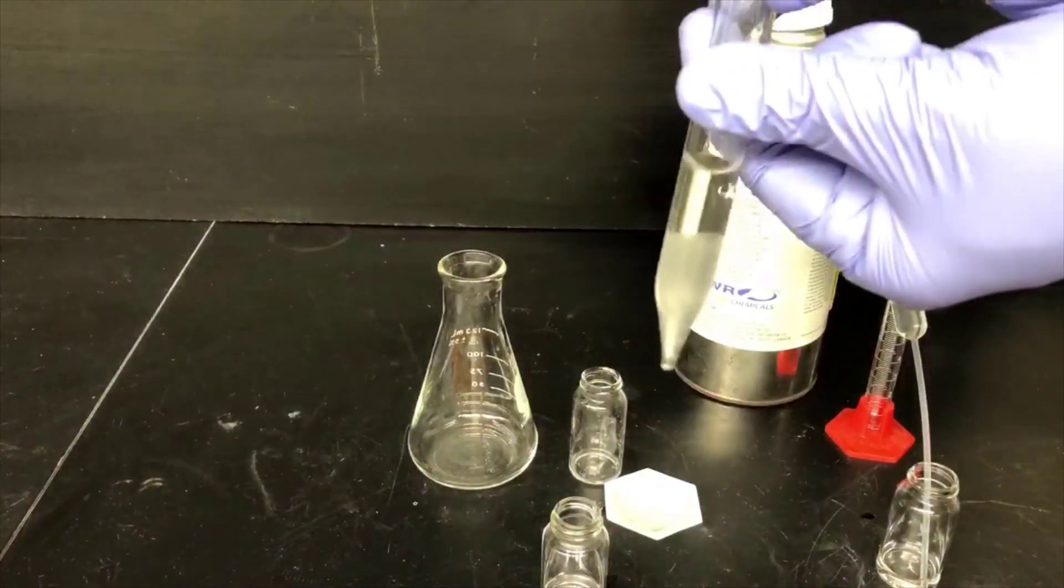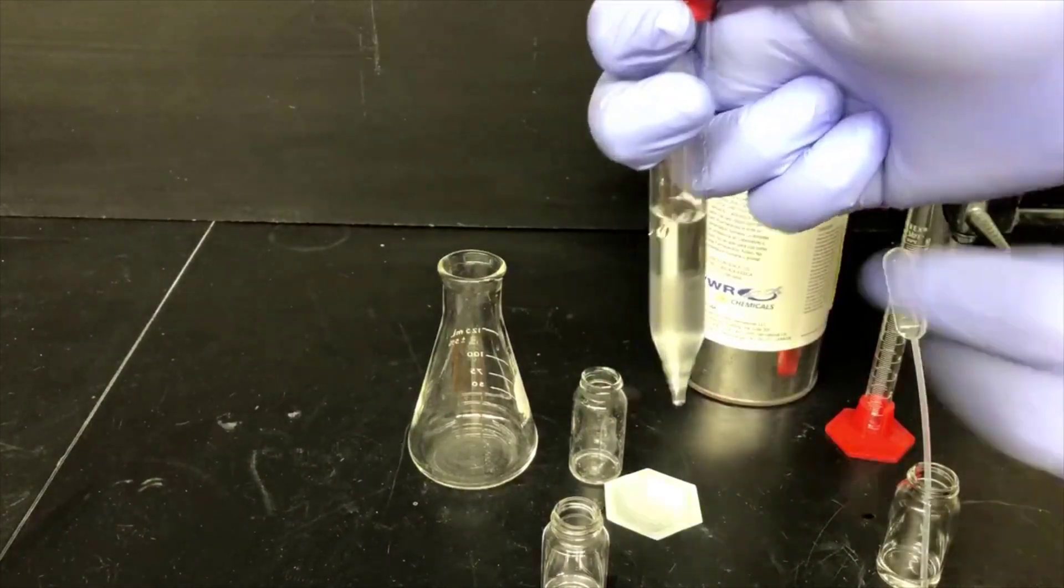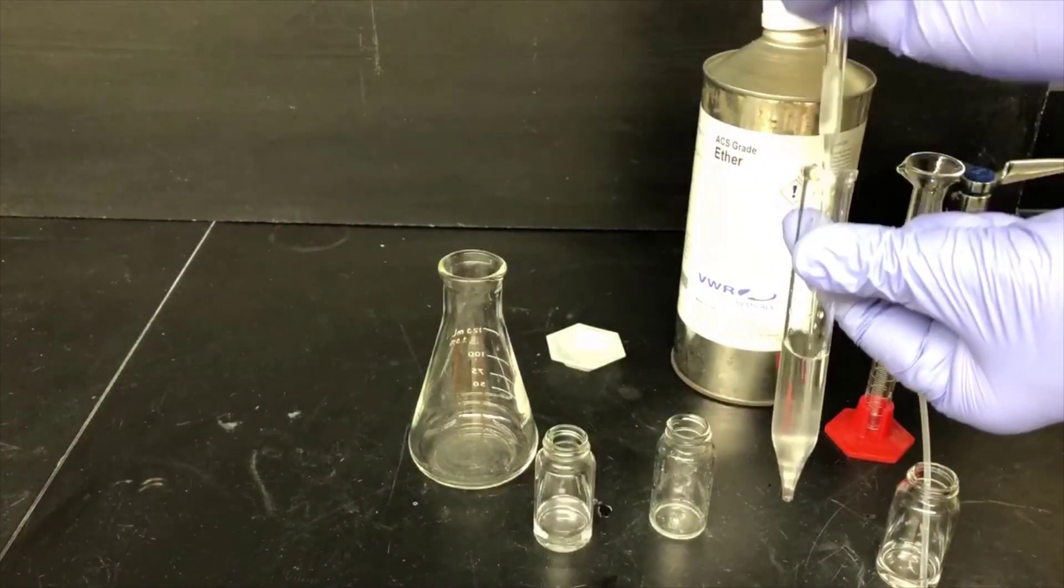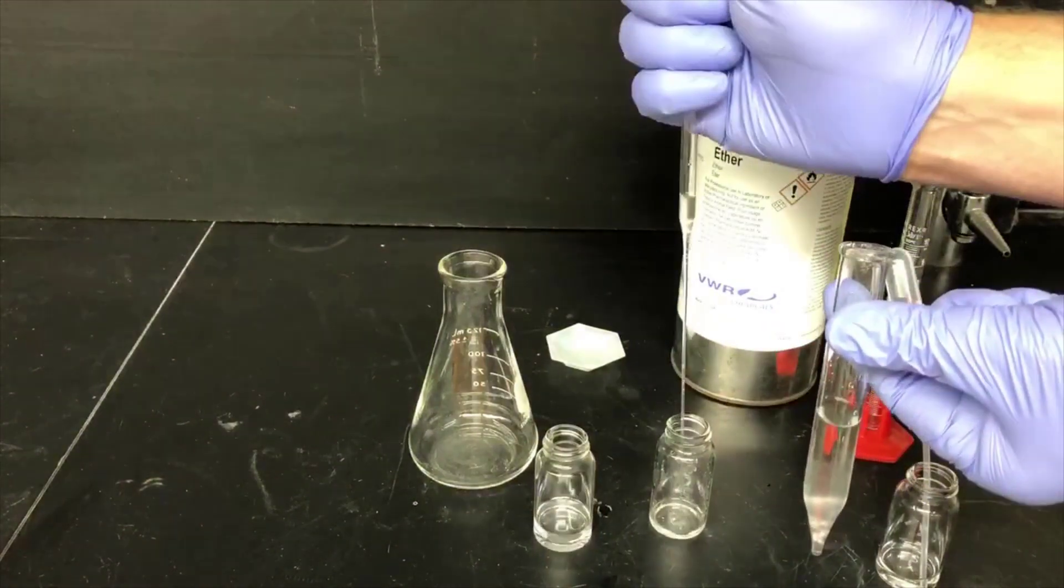I'll cap the tube and give it a shake. I'll let the layer separate, and then I'll pipette out the bottom layer as I did before.